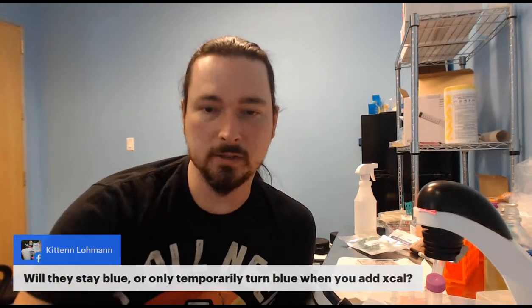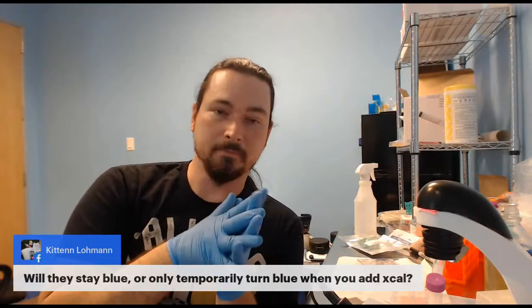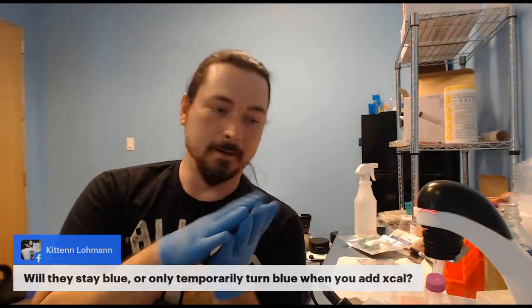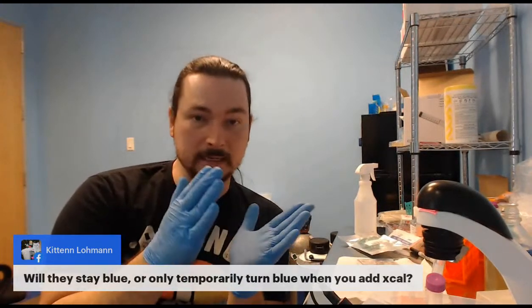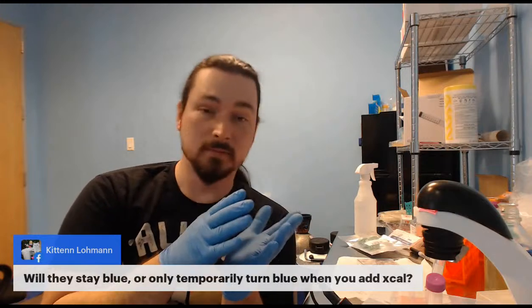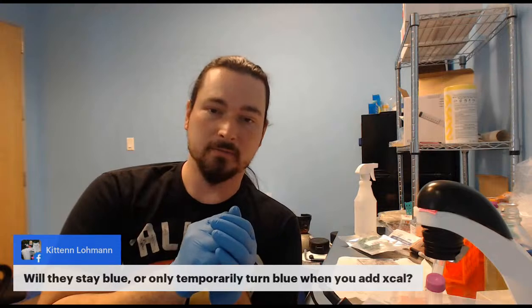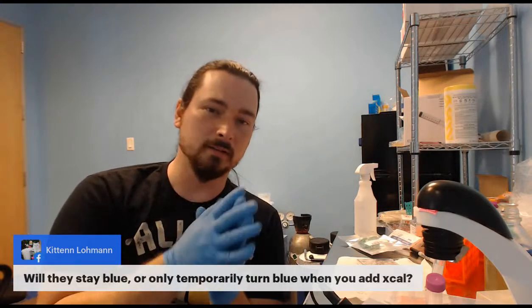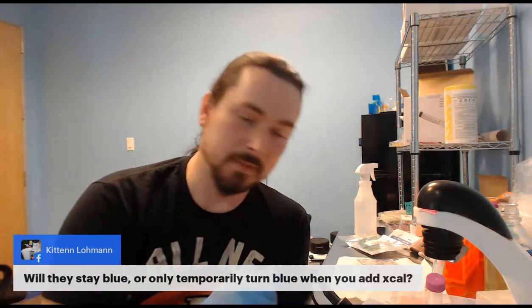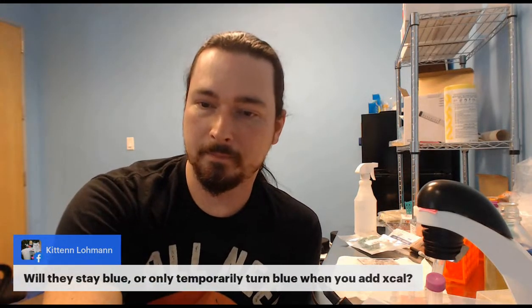The XGAL is the blue stuff. They won't turn blue without it, and once it's broken down, it'll peak, and that's as blue as they're going to get unless you add more XGAL. When you change the media next time, if you don't add XGAL, it won't be blue. The cells might take a little bit longer to get less blue because they're stained now. But they won't continuously do it unless you continuously add XGAL.